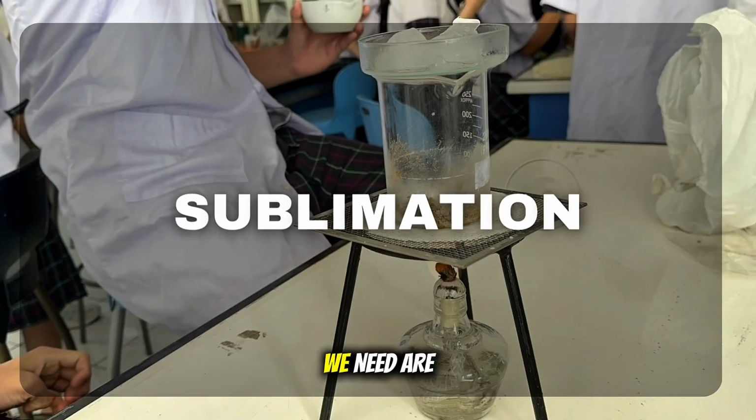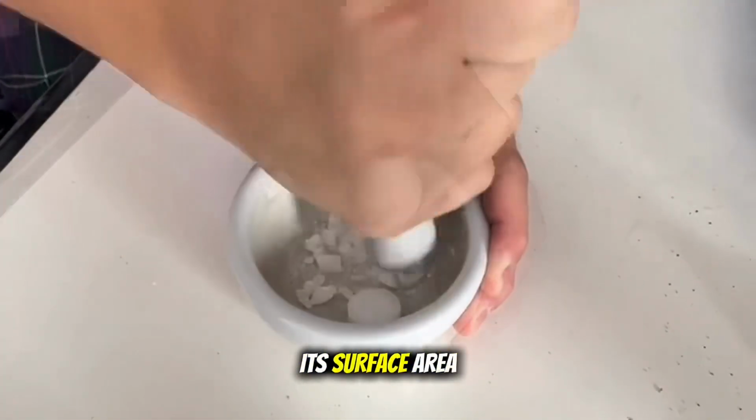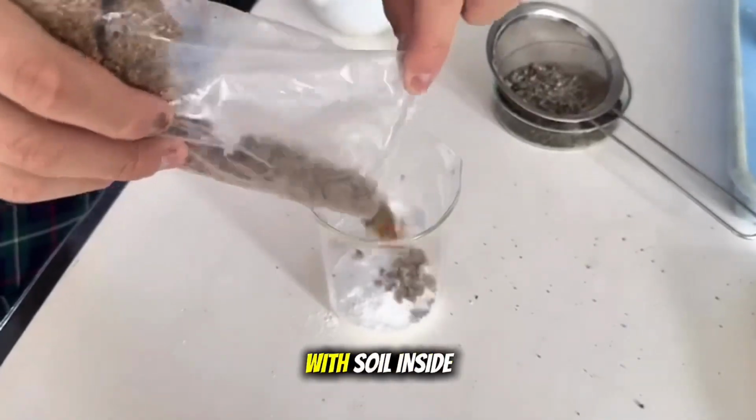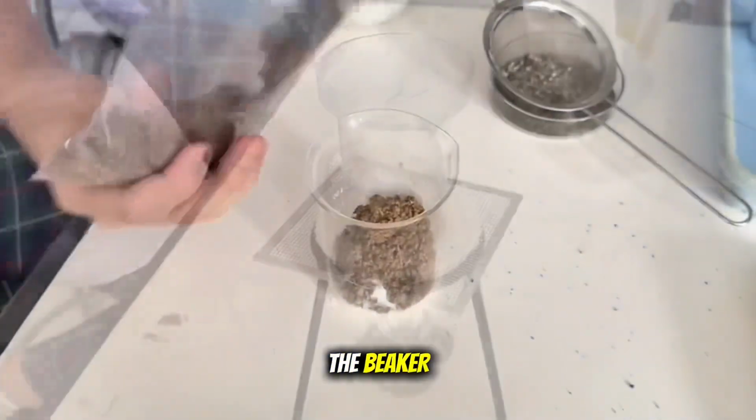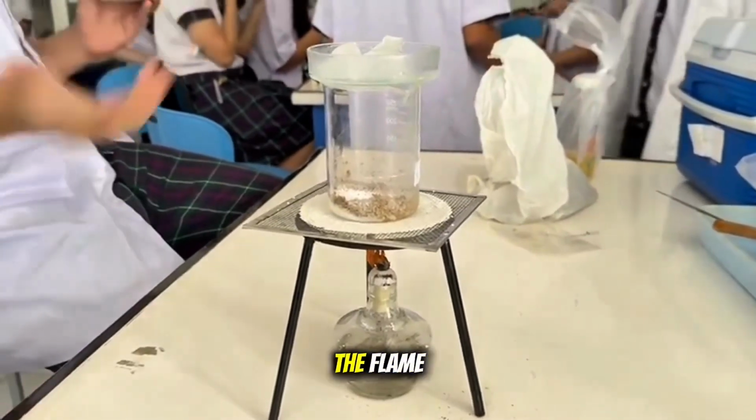Sublimation. The tools we need are a spirit lamp, a tripod stand, wire gauze, and a beaker glass. The materials are camphor, soil, and some ice cubes. First, the camphor is crushed to increase its surface area, and then mixed with soil inside the beaker. The beaker is placed on a wire gauze above the flame.